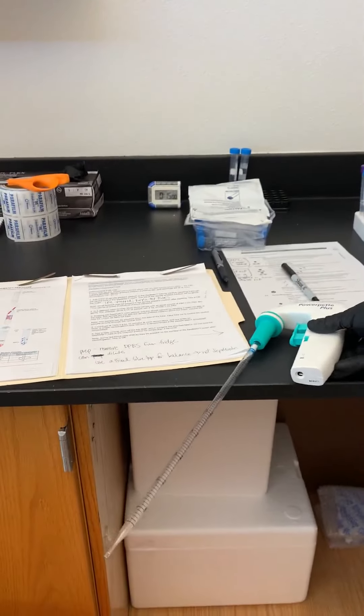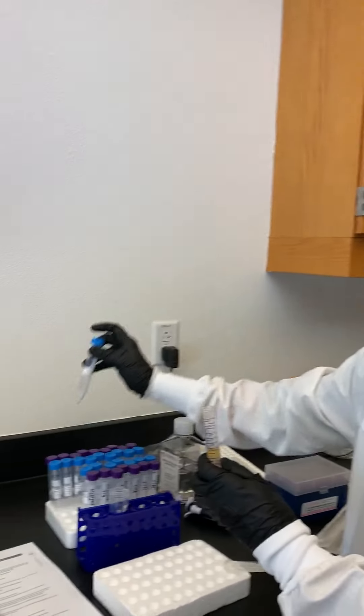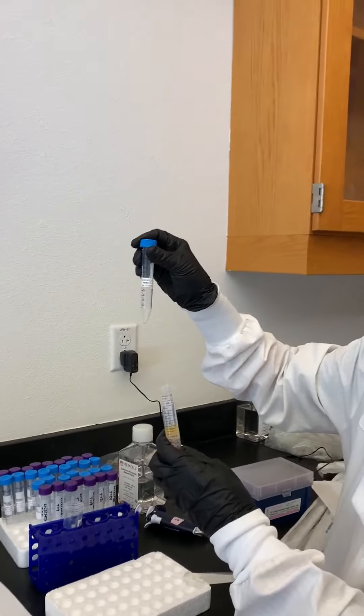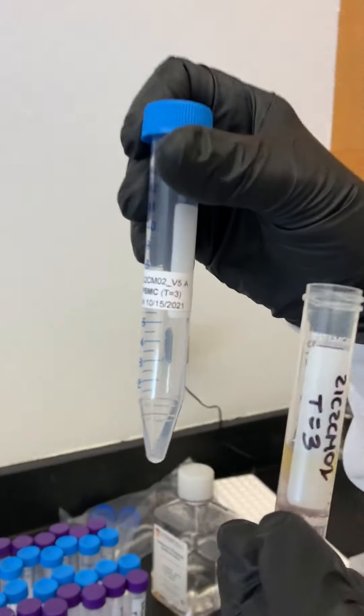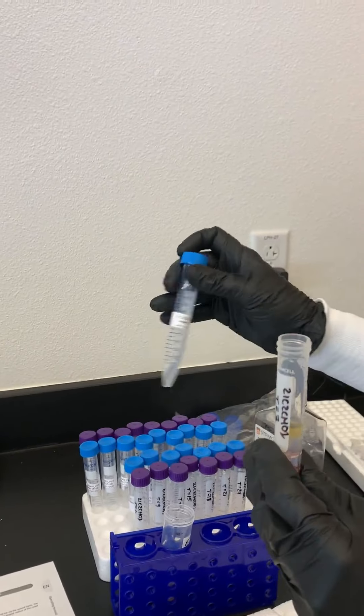This is where I'm going to discard, so I'm just going to put it over the waste. Now what we can do is take the blue-top tube — they're pre-labeled, so you want to confirm you're using the right label. It's the T equals three time point. They're lined up one behind the other, so it should be all right.